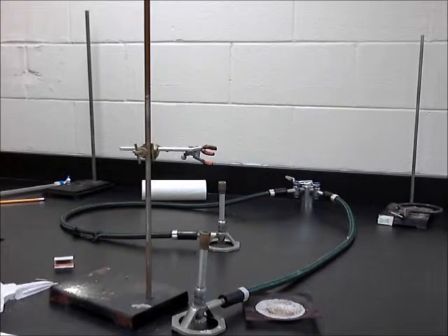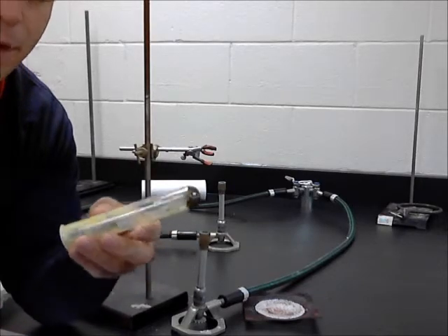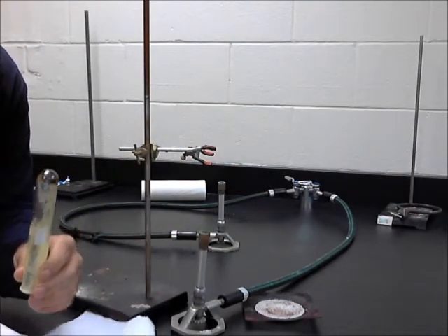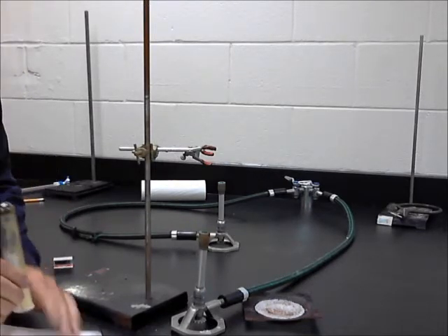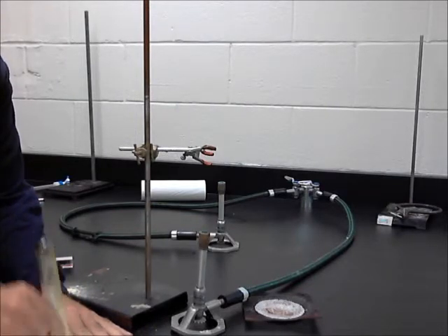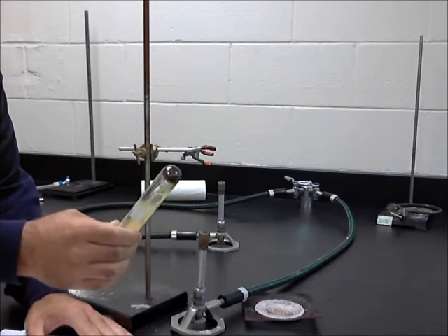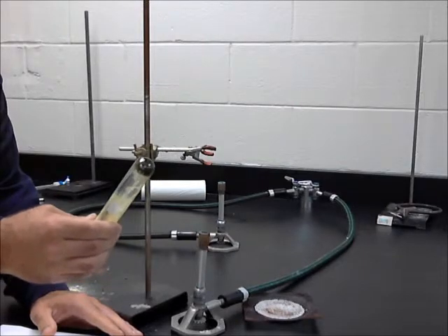Alright, so welcome back. This thing has now sufficiently cooled. What I would want to do is try to get this thing out of here, and you can do that by tapping it on something. I think the instructions mentioned using a piece of paper towel on top of your lab book. If this thing doesn't come out within a few quick taps, you're going to want to pull it out. Some of the smells now: when sulfur oxidizes, it gets kind of smelly. So if it won't come out, then break it.